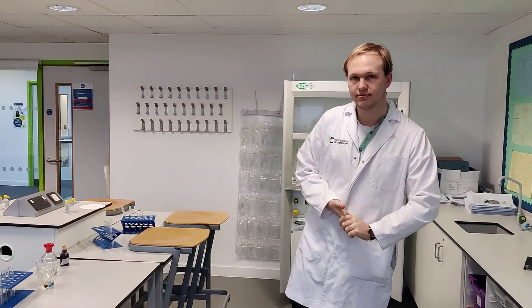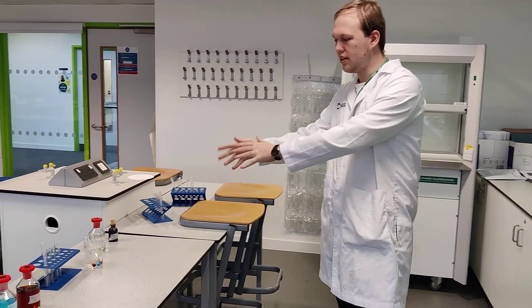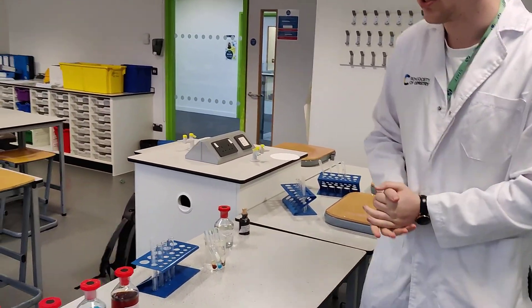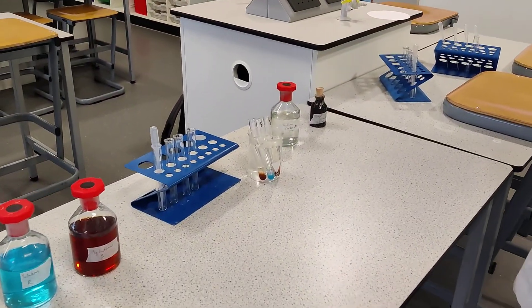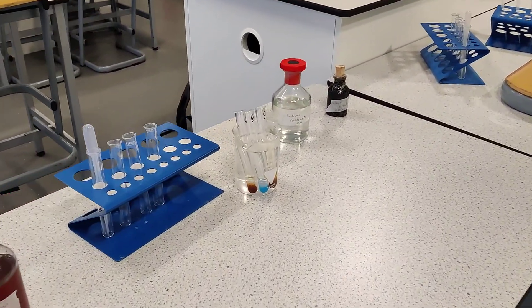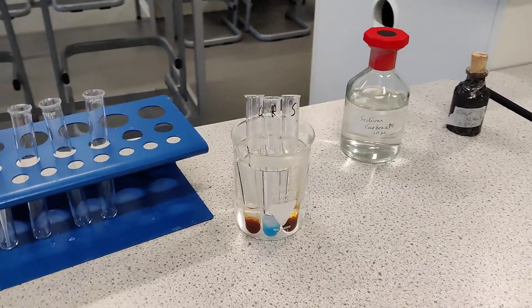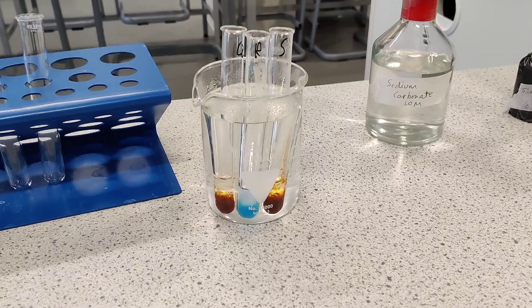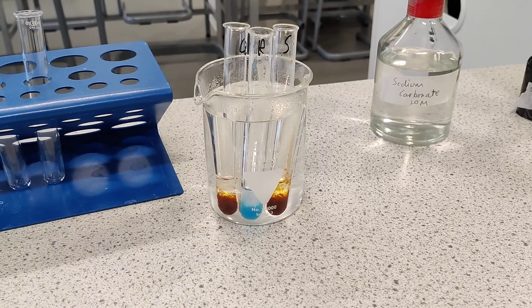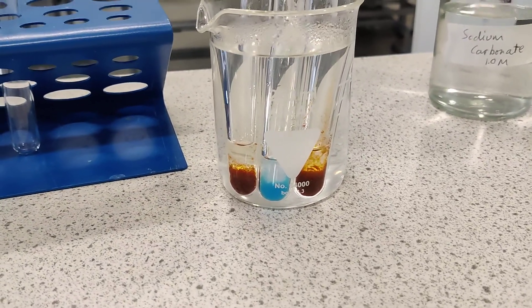Right, Mr Bell, we are back in the lab. What are we up to now? So now we've left these test tubes, these chemical tests, for 10 minutes in warm water. Now, as you can see, there is no observable change from what we have seen in the first chemical test.